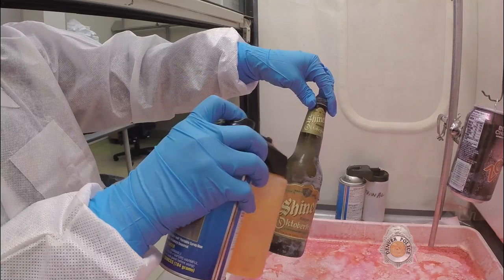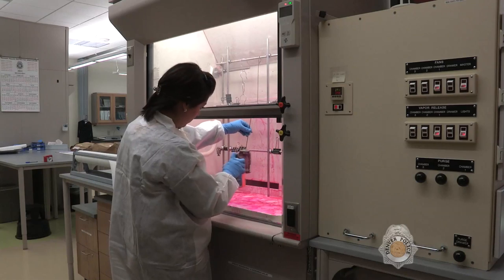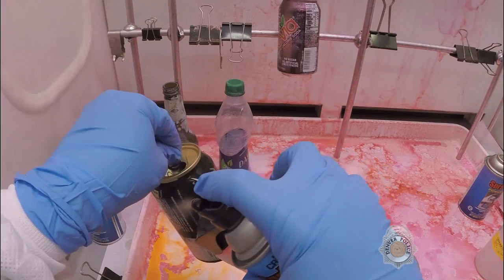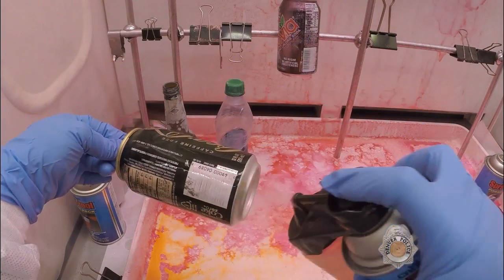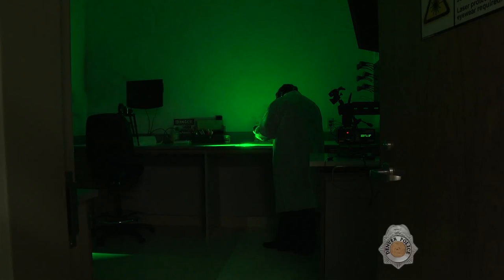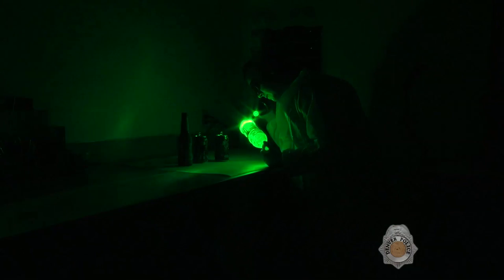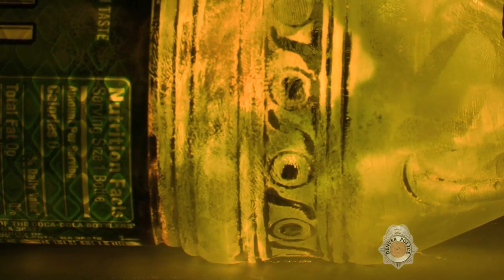A liquid dye stain is then applied to the items. The stain adheres to the cyanoacrylate residue, making any latent prints easier to view under a laser. The dye stain on these items is activated when put under the laser. Wearing color filtered goggles, an examiner can visualize any possible latent prints that may not be visible to the naked eye.